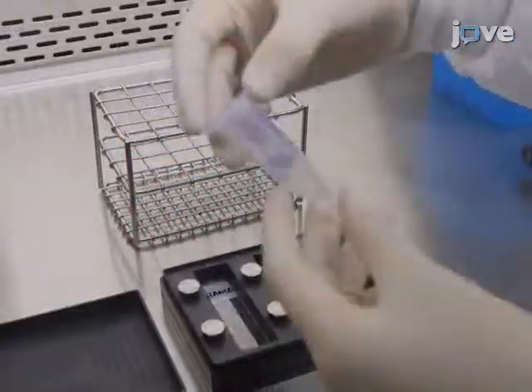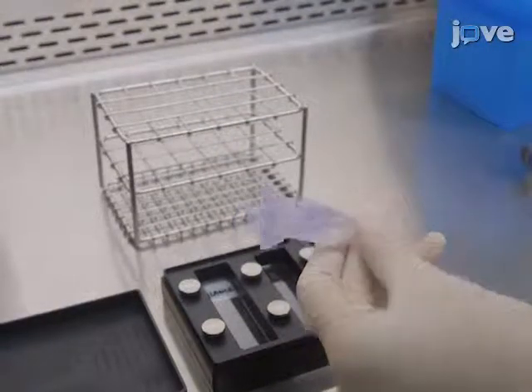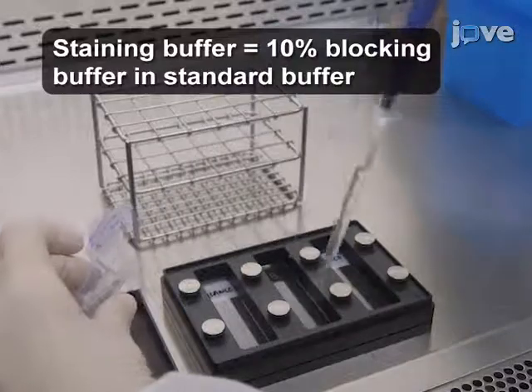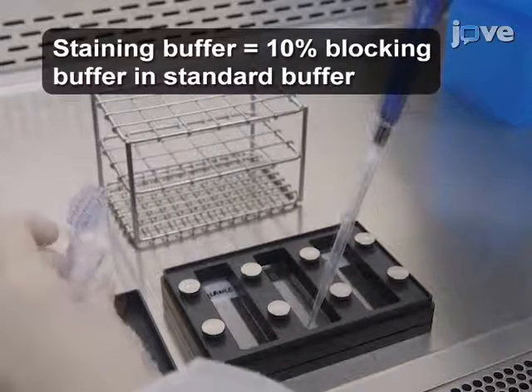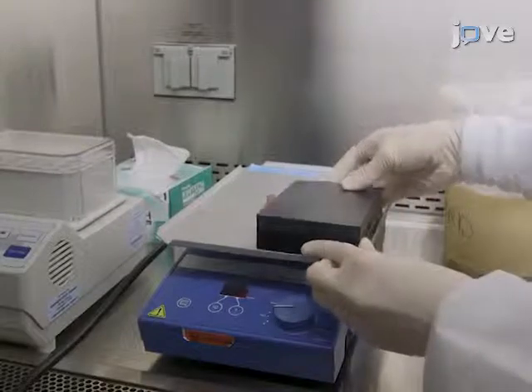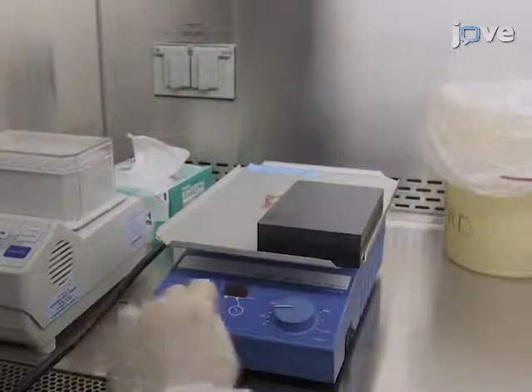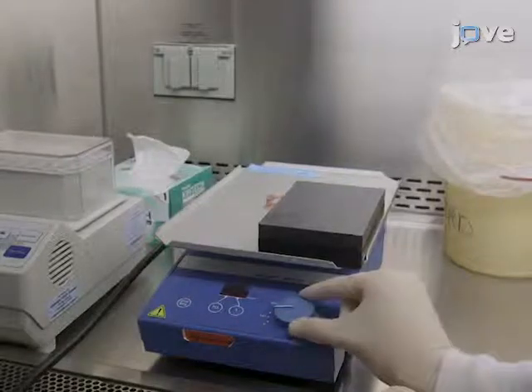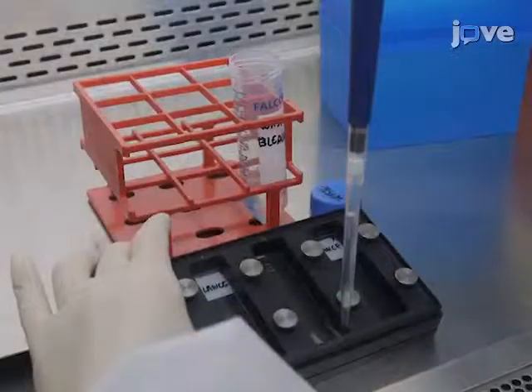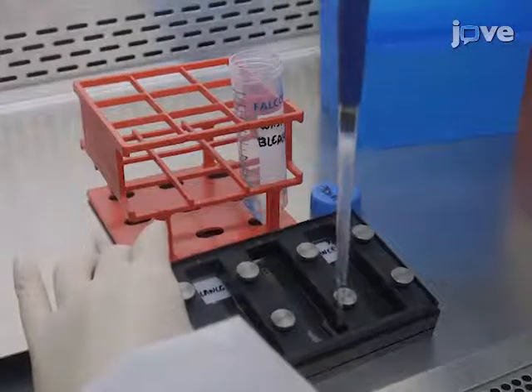Add anti-human IgM fluorochrome conjugated secondary antibody diluted 1 to 5,000 in the staining buffer to the microarray. Then incubate the microarray for 30 minutes at room temperature in the dark on an orbital shaker at 140 rpm. Use a pipette to remove the secondary antibody by aspirating from the corner of the microarray chamber.